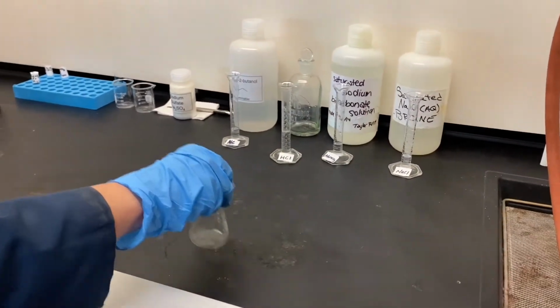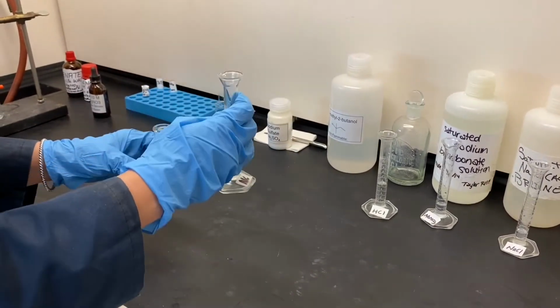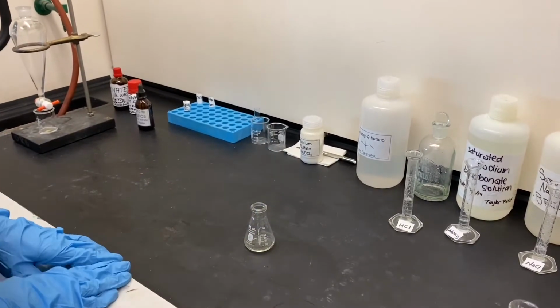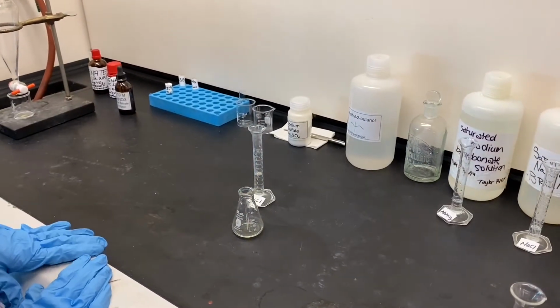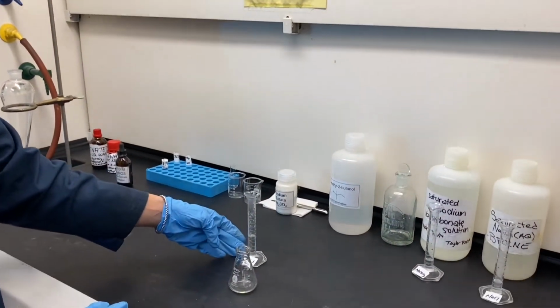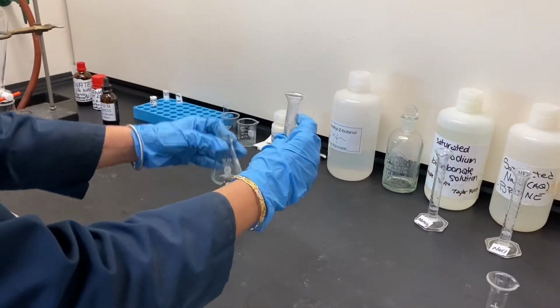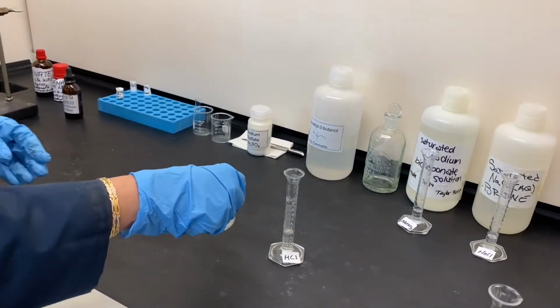So here, in a clean 50 ml Erlenmeyer flask, we will place our pre-measured butanol, the 2-methyl-2-butanol. To this, we will add concentrated HCl. Now remember to handle HCl under the fume hood because it is very corrosive. Before you add to the flask, be careful to add HCl in several small portions. So here I am adding HCl in small portions and swirling after each addition.